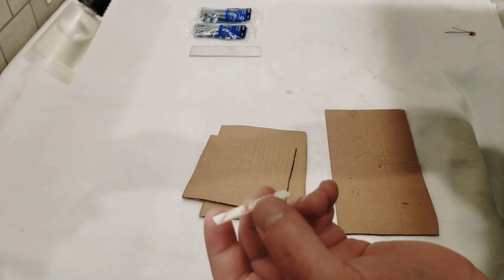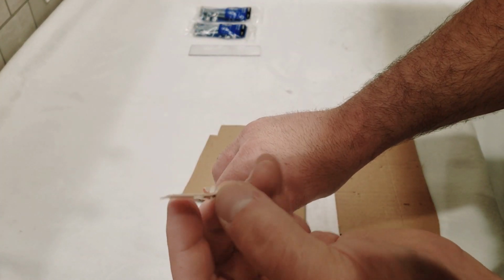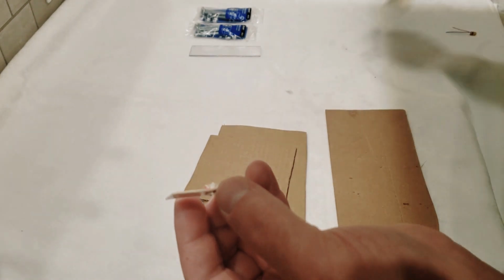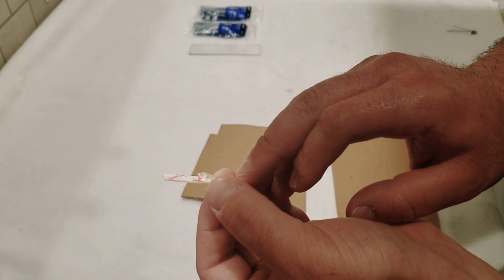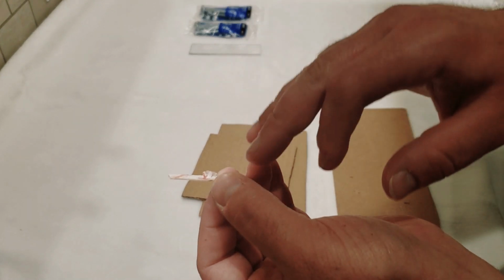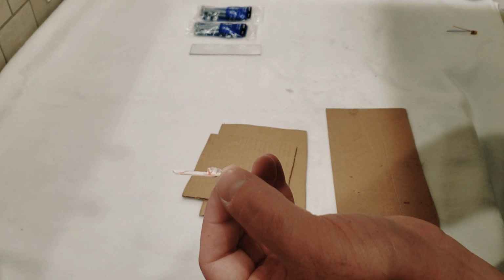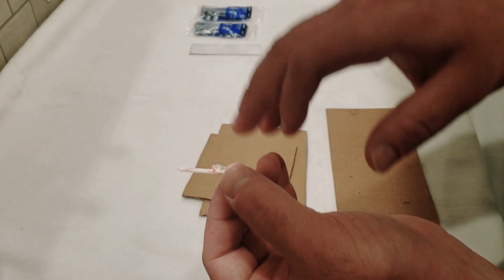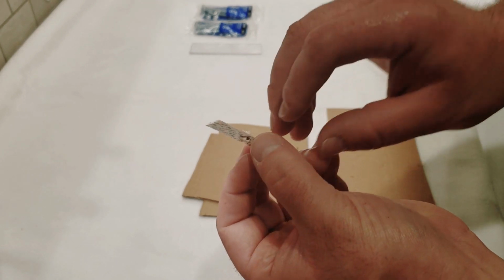And so it turns out we didn't even need the super glue. I was just going to throw a little super glue on the sides of that to hold it in place. But it's a good thing we didn't need it because in some of my other runs, the fumes from the cyanoacrylate actually melt or bond with the plastic, I'm not sure, but it hazes over the lenses. So I'm glad we don't have to deal with that.